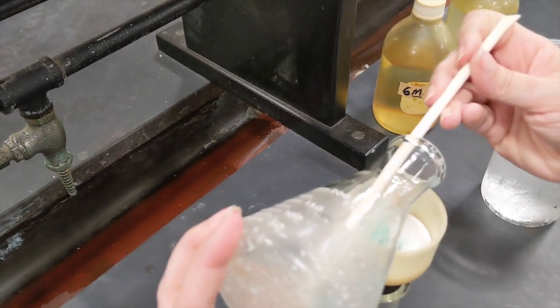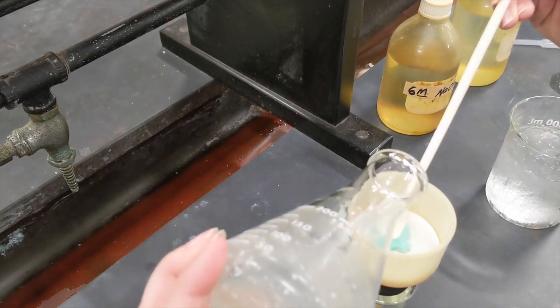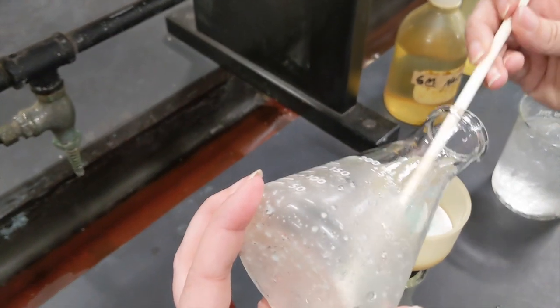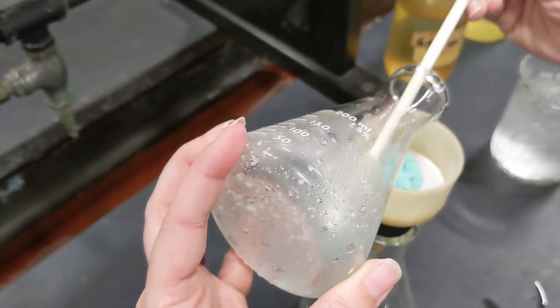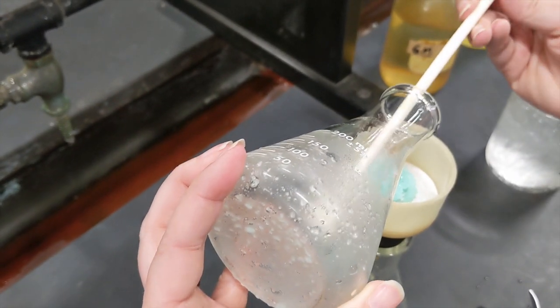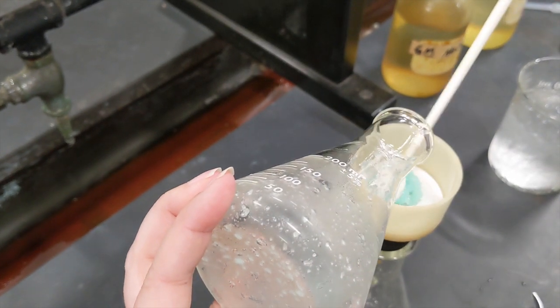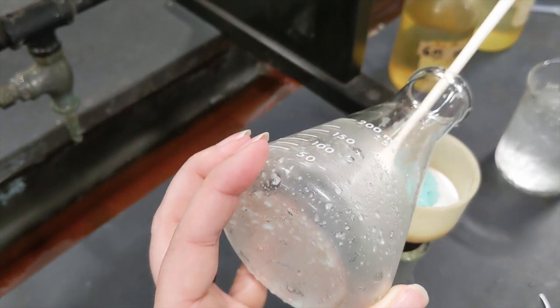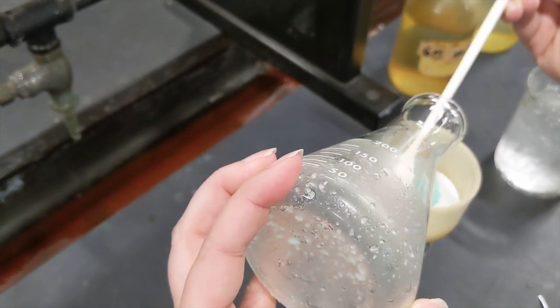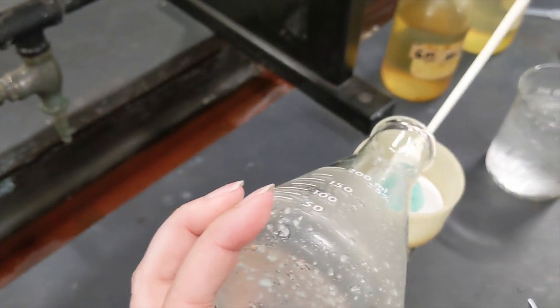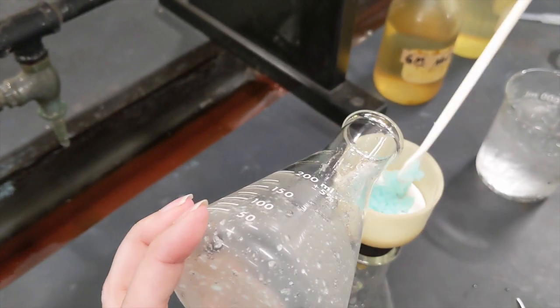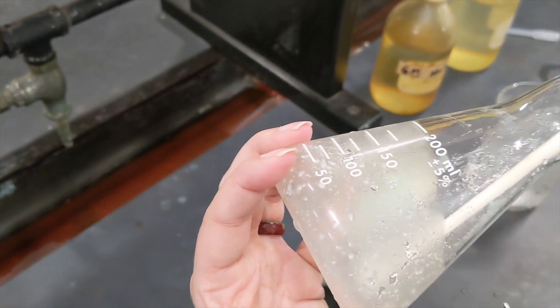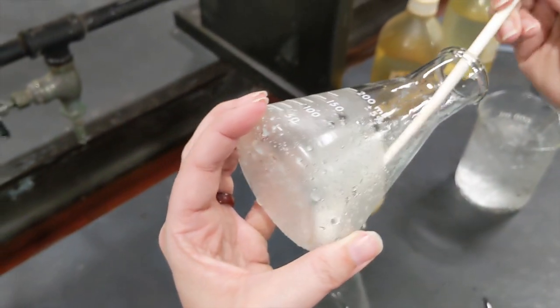I could use more water to help rinse this out and carry it, but this iron sulfate is fairly water soluble, so the more water I put on it, the less of my final product I'm going to have. And we'd always like a nice big percent yield, right? A nice big number of grams that we make divided by grams that we theoretically could have made. I also want to be sure that I have plenty of this product because I know what I'm going to do for lab tomorrow.